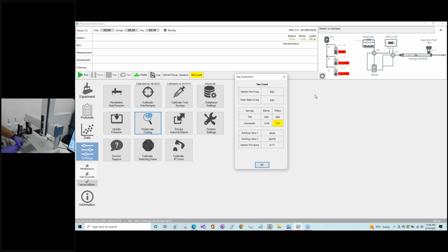Just while Marina's doing that, I wanted to point out that it would be good to familiarize yourself. When you get a new piston barrel combination, feel how tightly fitting that piston is in the barrel for a new test syringe piston combination. Get a feel for that and compare it to one that you're changing out because it has expired. So you can see how dramatically they can age over time and why it is important to keep up with this maintenance activity so that you have the best data possible.